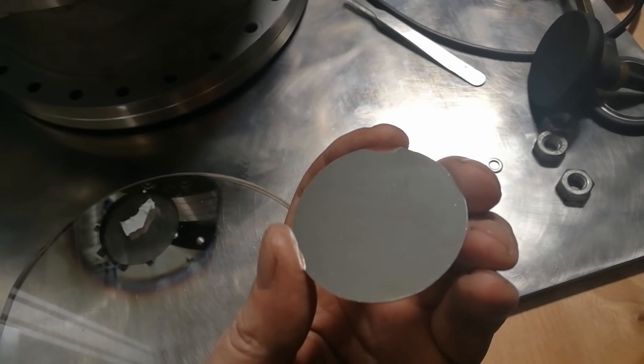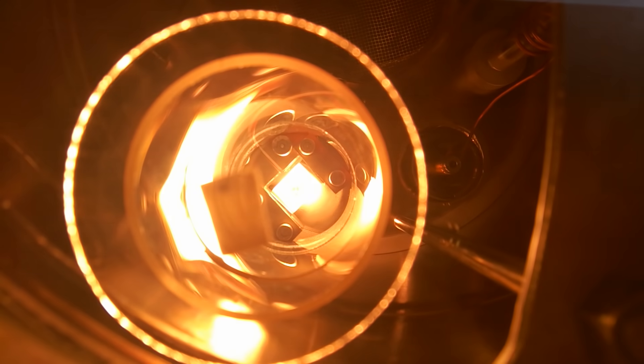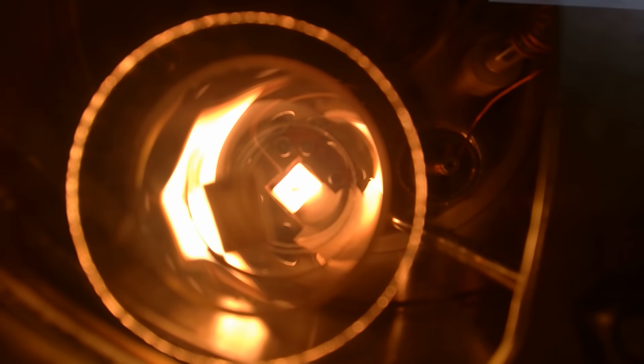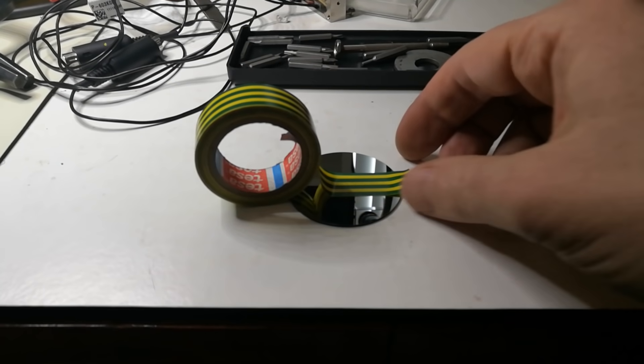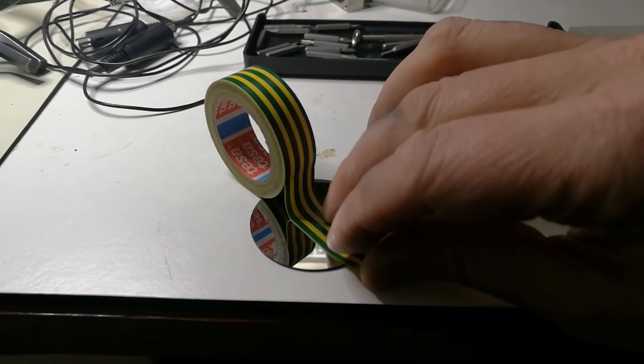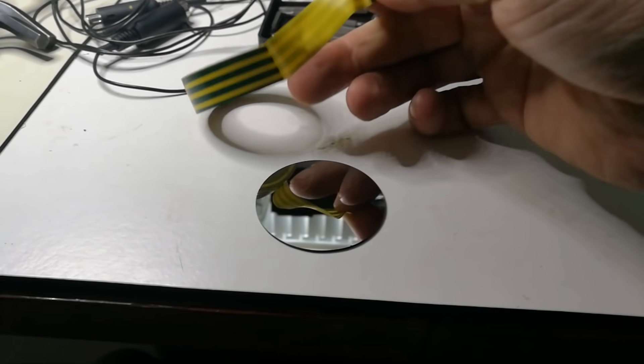Silver generally adheres very badly to glass. So just to be sure that the plasma cleaning works well, I repeated the same process but then using chromium instead of silver. Chromium adheres very well to glass. In this case I could comfortably perform a tape test multiple times without any layer delamination, which means that there is indeed very good adhesion.